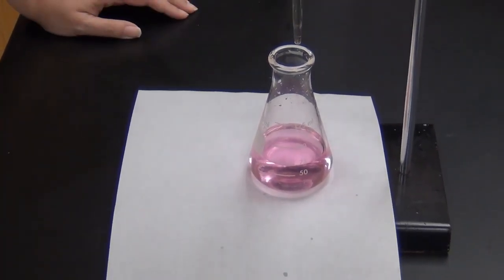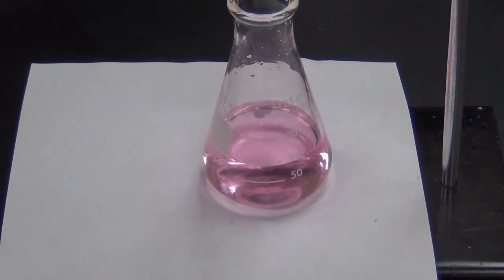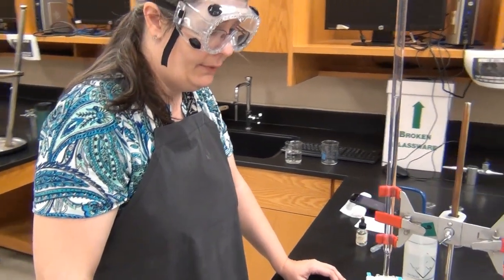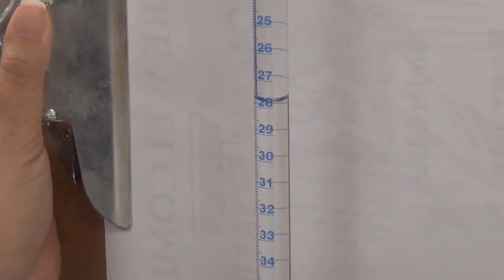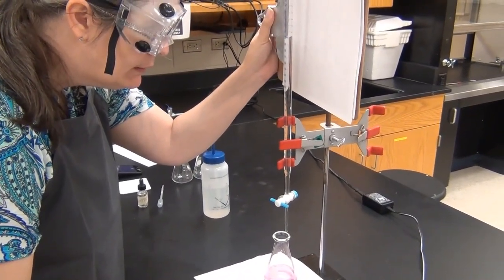After adding the last drop, even while swirling, the solution stays pink — I have reached the end point. I've added enough base solution to neutralize all of the acid in the flask. Now I need to get my ending volume on the burette. I crouch down to get eye level — I'm between the 27 and 28 milliliter marks, and it looks just a tiny bit between the 8 and 9 lines, so I call that 27.82 milliliters. My ending volume is 27.82 mL.